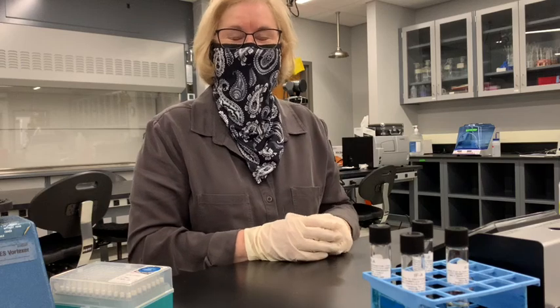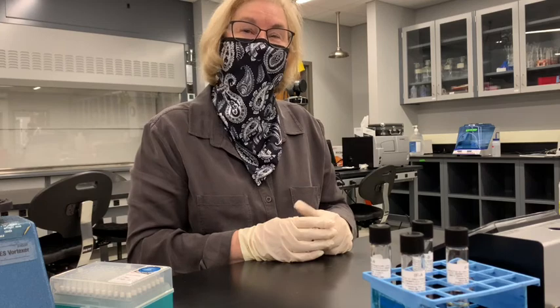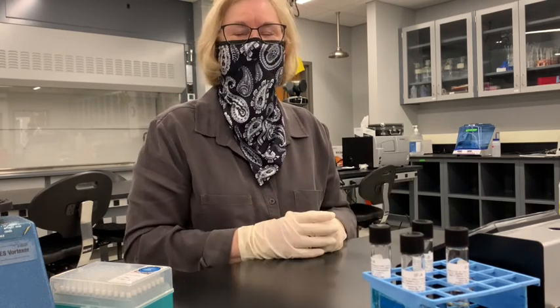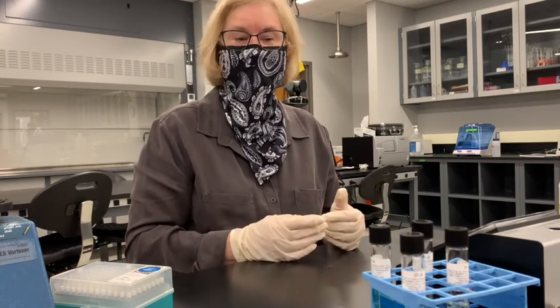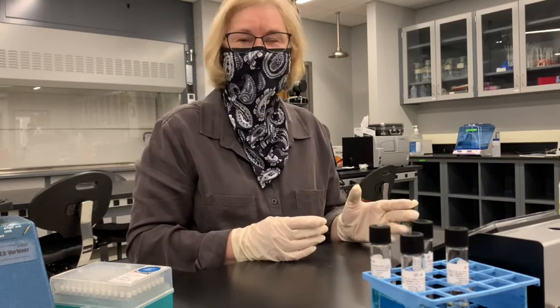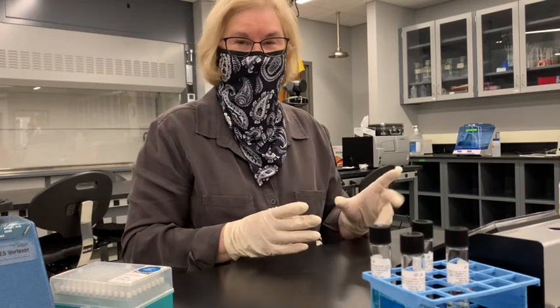Hi guys, it's me. I'm here in the lab and I'm going to show you how to run a Biolog phenotypic array. What that does is show us which organism you have down to the species level. So it's not only going to tell you the genus, but also the species. It's a really amazing system.